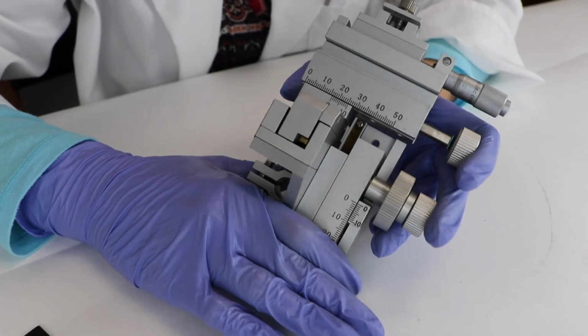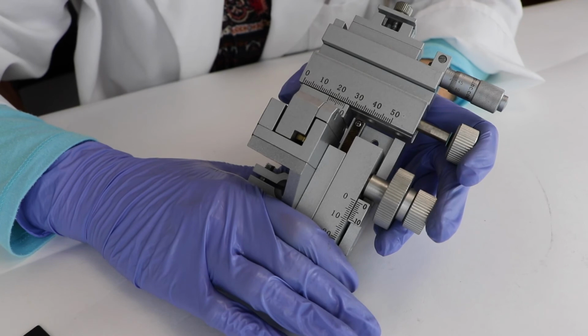So that's how you adjust drift on a KITE. If you have any questions, just give us a call.